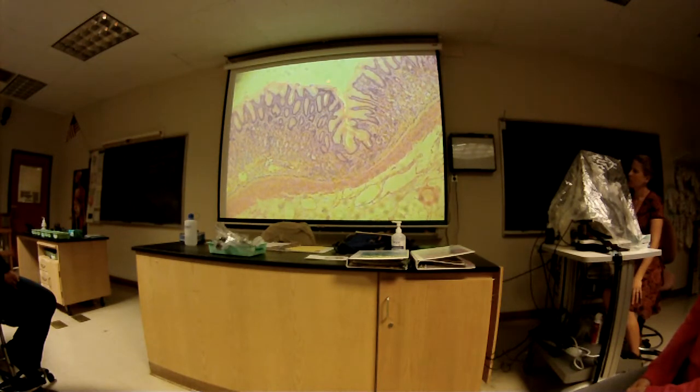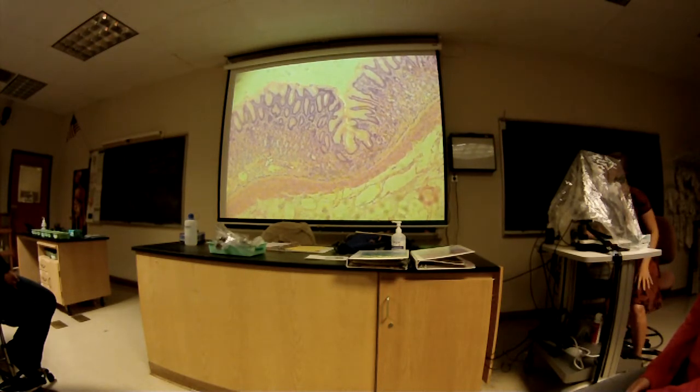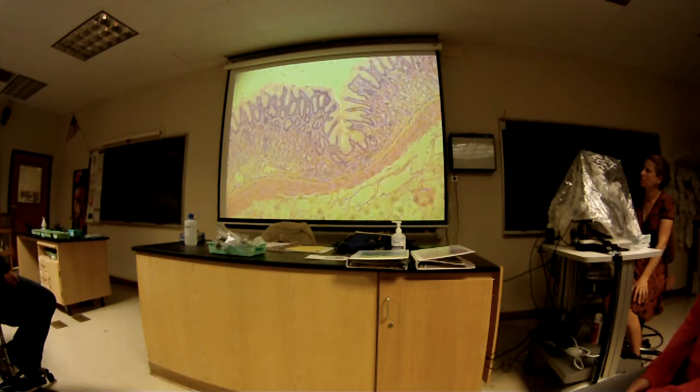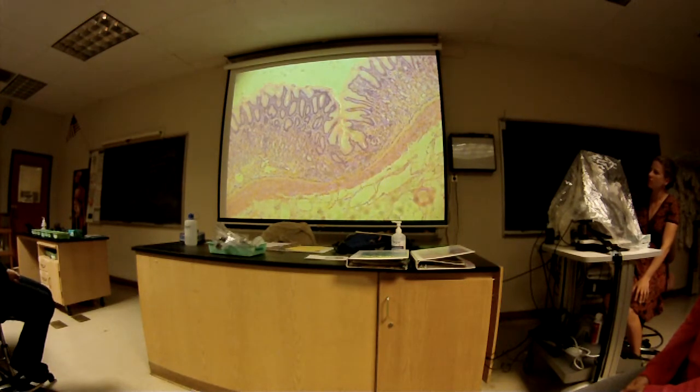So a gastric pit is where the opening down in here is the pit, and the gastric glands are a collection of cells down here inside of the pit. The glands are inside of the pit. So these are openings. It's a pitted stomach, and so you're seeing openings to other sections of the stomach as well. But this is one where you got a nice full view of a gastric pit.